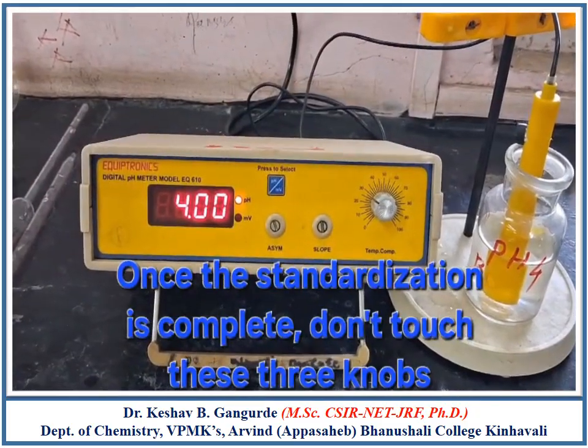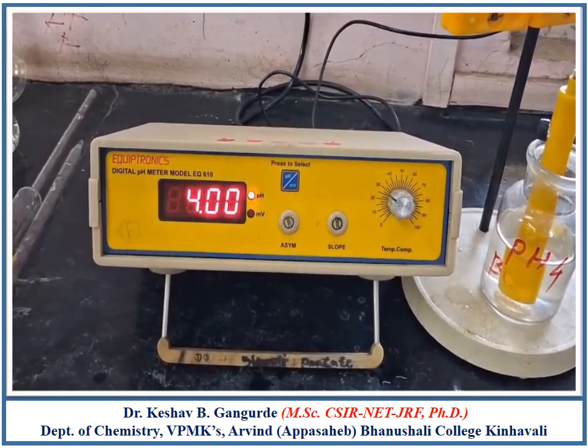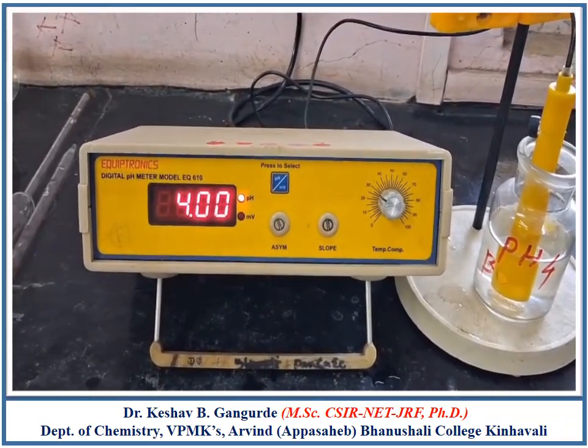Once the standardization is done, do not touch the temperature knob, asymmetric knob and slope knob.